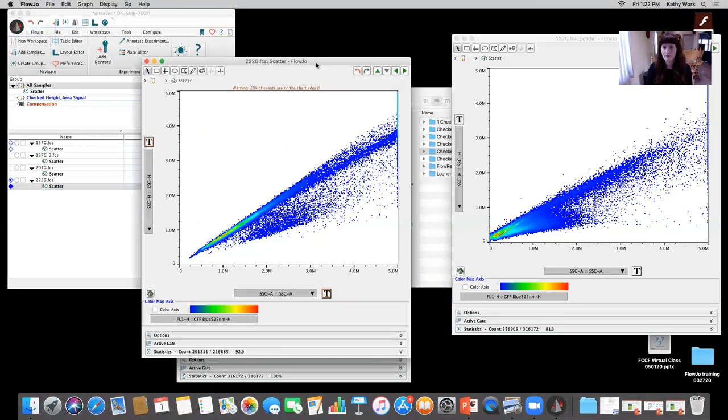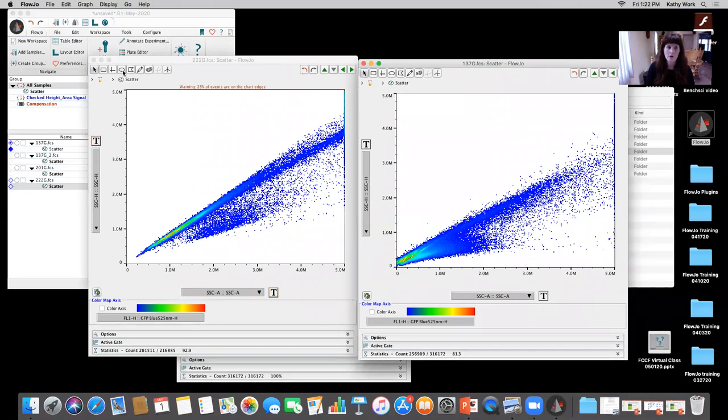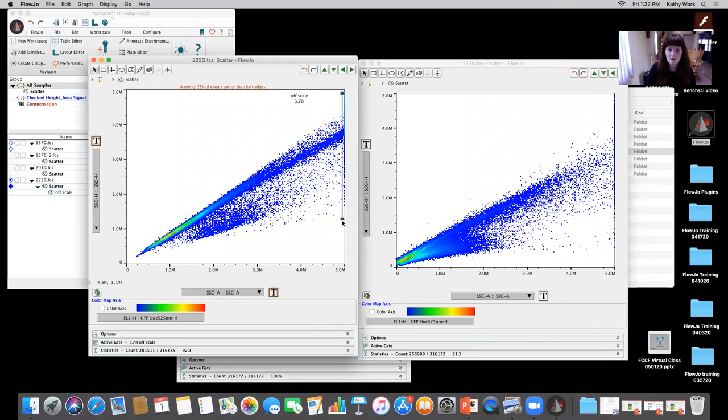This looks a little bit deceiving here, because on the left is the one where we didn't change those detector settings, and the one on the right is where we did. But if I choose this little rectangular gate, I really make sure I'm including everything. I have quite a bit that's off scale that I'm not even able to visualize, if I have everything within the range where the height is not saturated. So this is a good example of making sure you understand your instrument and you know what you're looking for, so that you can accurately gate and get reliable gating from the cells that you're working with, okay?